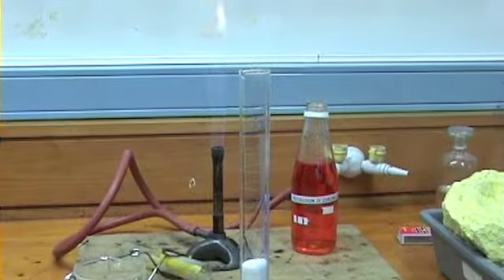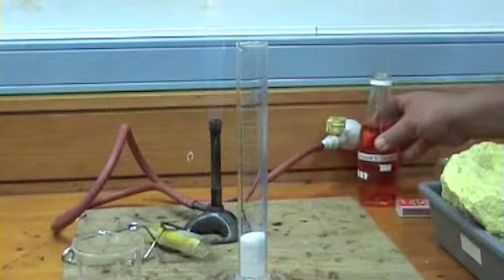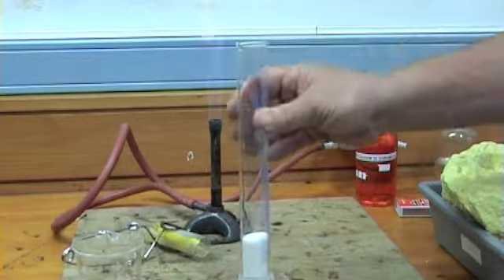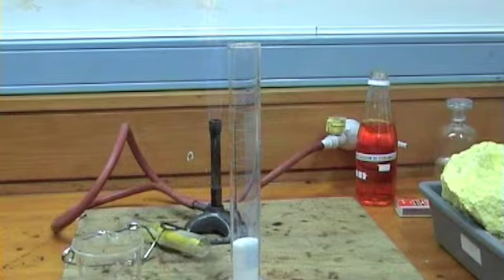This is a demonstration of the dehydrating power of concentrated sulfuric acid. It starts off slowly, but it does speed up a bit as time goes on, okay? This is ordinary table sugar, C12H22O11, which is a carbohydrate. Of course, the definition of a carbohydrate is a compound of carbon and hydrogen and oxygen, where the hydrogen to oxygen ratio is 2 to 1.